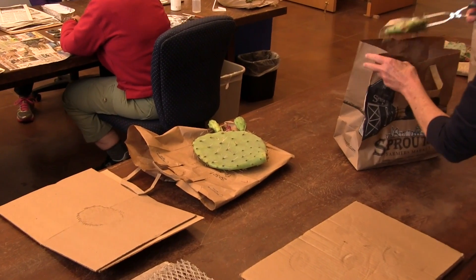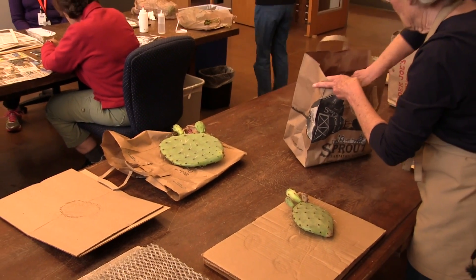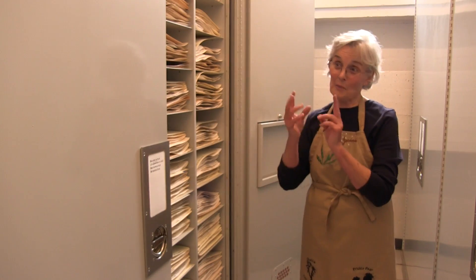The cactus has too much moisture in there, and our ideal process is to get rid of the moisture and flatten everything down as flat as we can, or we would not have room in our library for everything if the spines are sticking up.